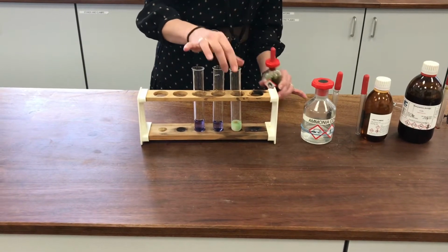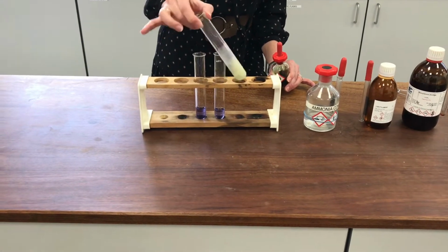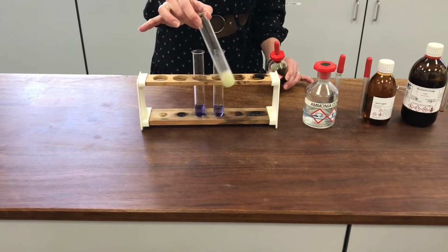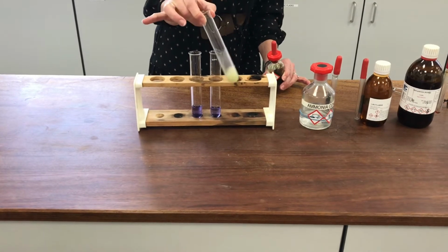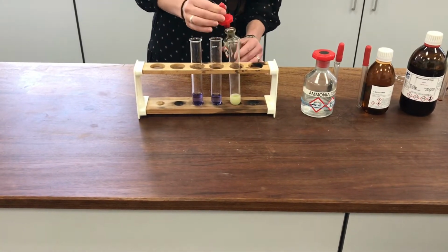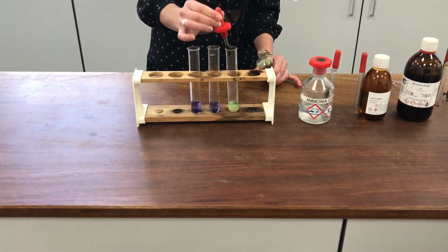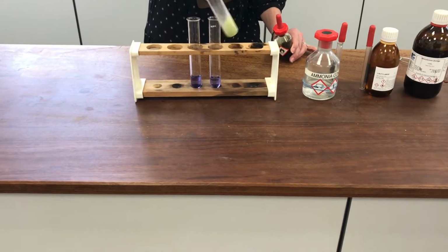Okay, now this one is less convincing because it's not as soluble, so it has a kind of greenish tinge to it. It's not actually neutral, it is slightly basic, so it's a slightly sort of bluish green, but you can see how the basicity of this one compares with the previous ones. It's not helped by the fact that the phenylamine itself has got a yellowish colour to it, which is affecting how this appears.